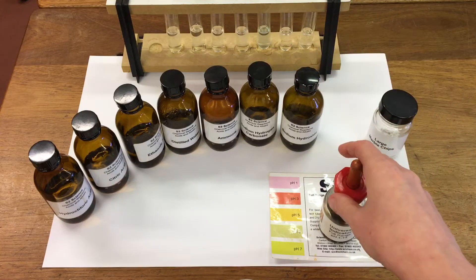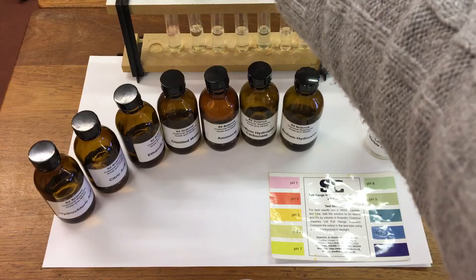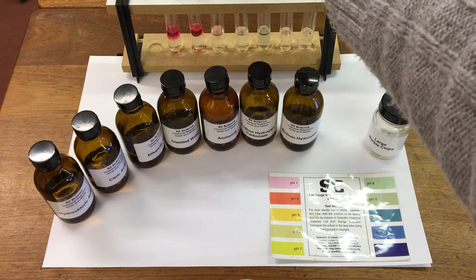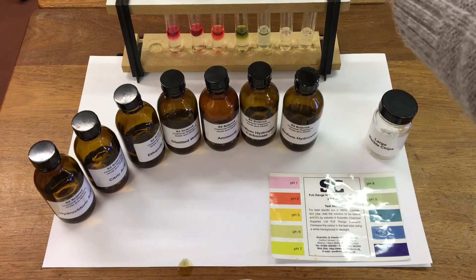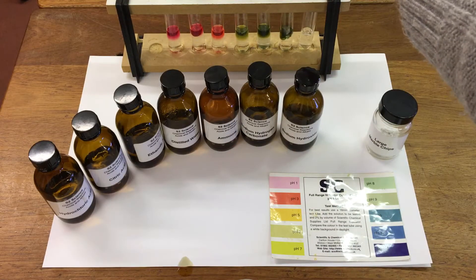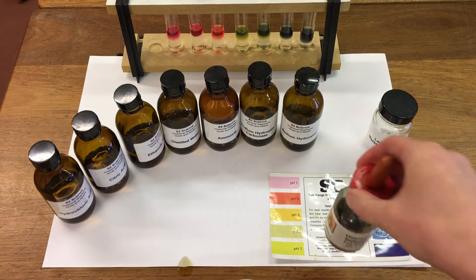To each test tube I'm going to add a few drops of our universal indicator. And we'll then gently mix the test tubes.